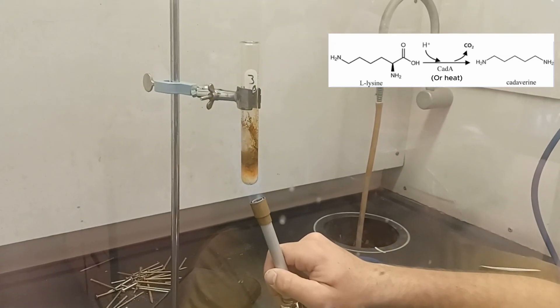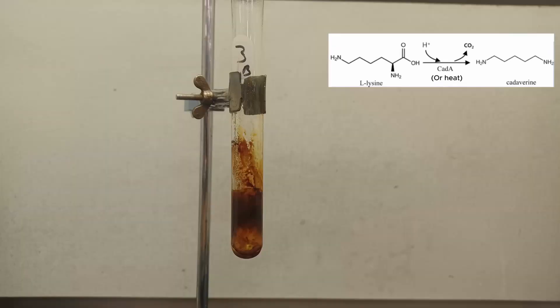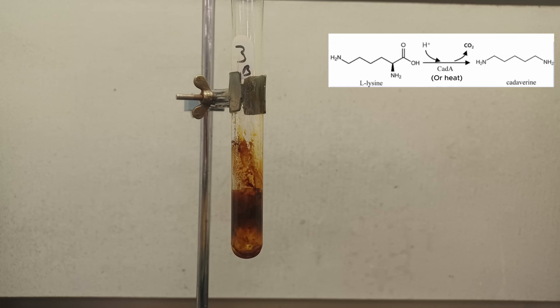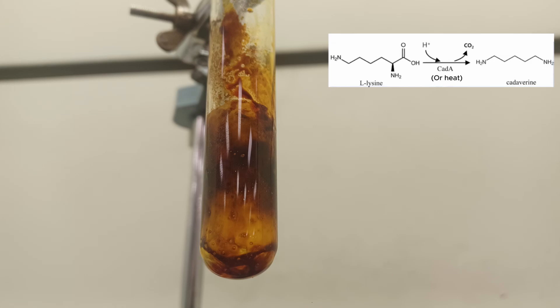Cadaverine has one more hydrogen than lysine is able to supply, which is why sodium bicarbonate is used. When broken down, sodium bicarbonate also releases carbon dioxide, but also hydrogen. The hydrogen is greatly favored to form cadaverine and improves the efficiency of the reaction.